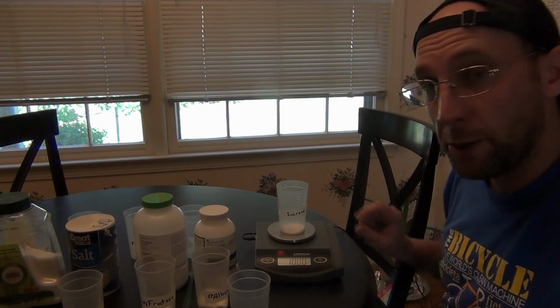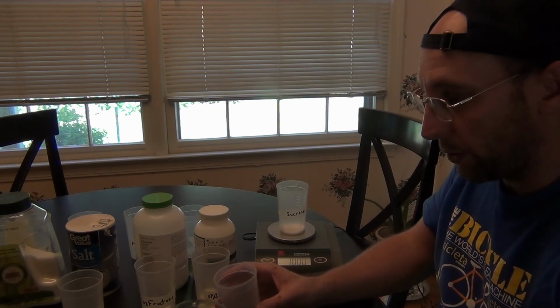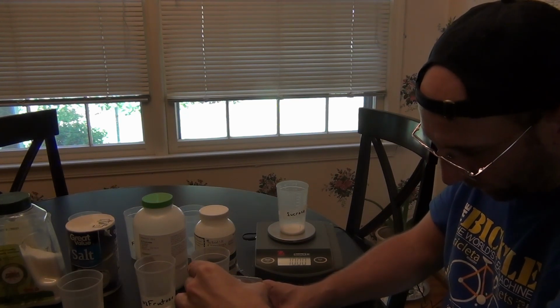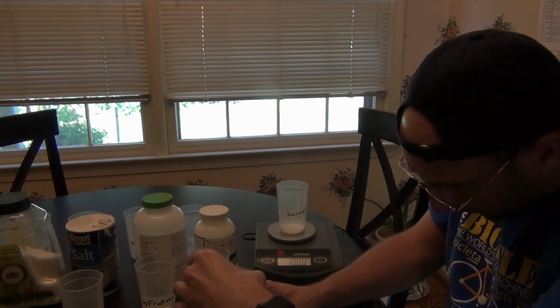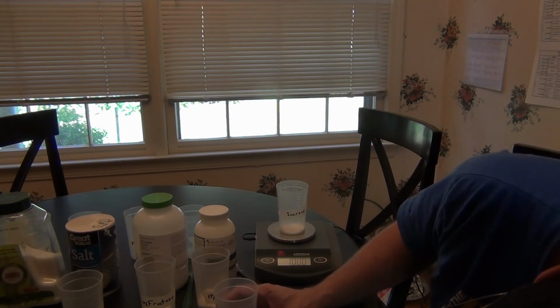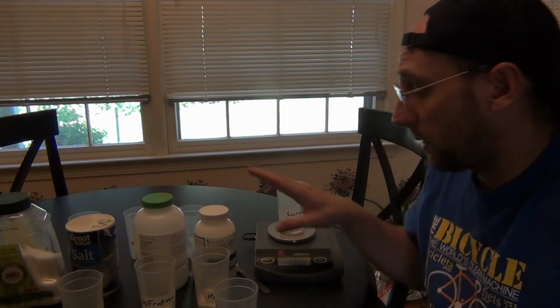Okay, so I already measured out, for instance, 10 grams of sucrose. To make it a 10% solution, I'm going to add 90 milliliters of water. Now, if I was at school, I would use a graduated cylinder because it's much more accurate than these plastic beakers that I have. But I'm going to use these. The actual percents might vary just a little bit, but they'll be close enough for what we need them to be. Again, 10% solutions of all of them except for albumin, which hopefully will come out to be a 5%.